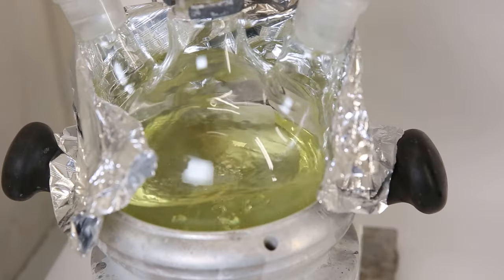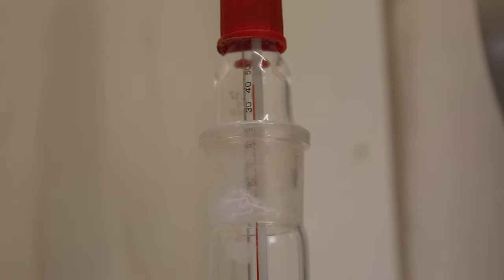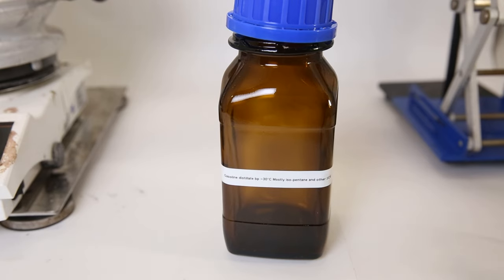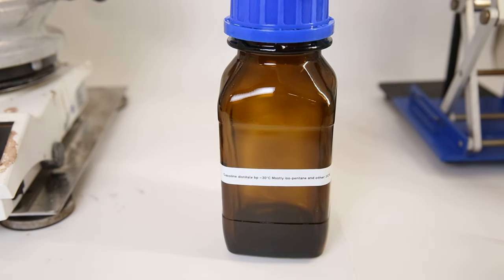A few minutes later, the temperature started increasing to above 40°C, and I decided to empty the flask and collect my first fraction, which consists of mostly C5 hydrocarbons and lower.